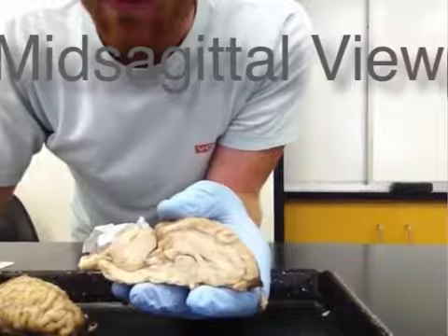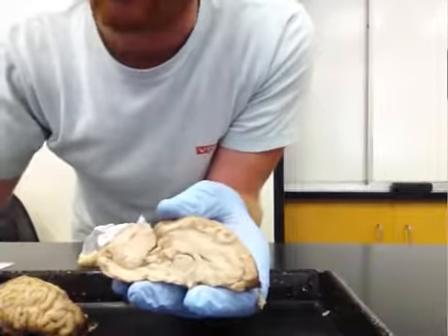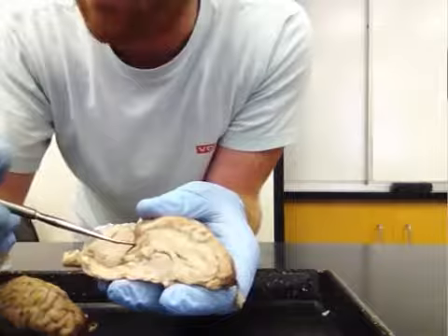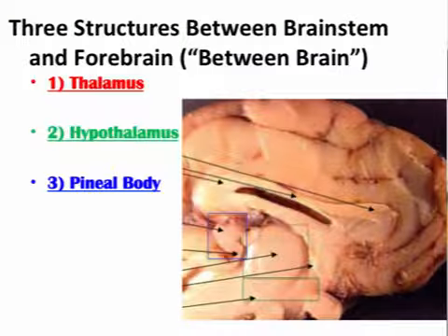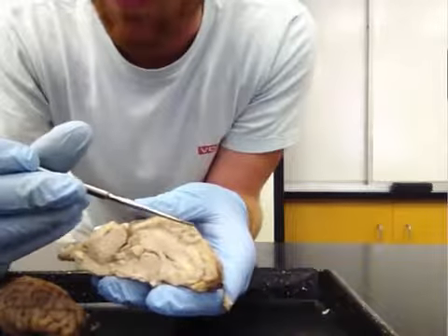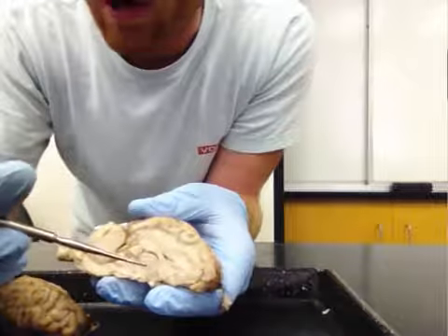Okay, so now that we've made our mid-sagittal cut, we can actually start seeing some structures that we couldn't see before from the external surface of the brain, structures that are embedded inside the brain. And a lot of these structures are going to be what are known as the between brain or diencephalon. It's between brain, right, because it's located between the forebrain, where the cortex is, and the brainstem. So this is all between brain.